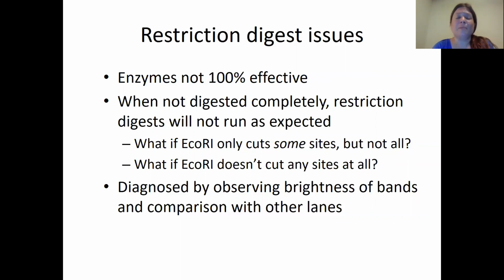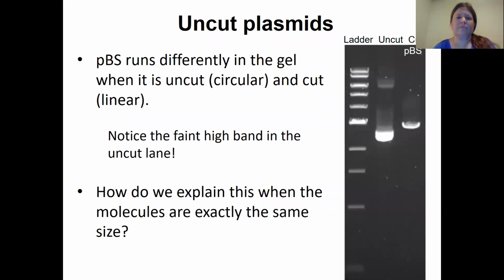You can also tell by comparing to other lanes, based on the brightness of the bands, whether you've got a scenario where none of the sites were cut. Let's look at that for a minute. Our plasmids are circular. The ladder that we have is linear. We know that pBluescript is 3 kb, but we're comparing that to a linear standard. And circular DNA is shaped funny. It's not going to run the same speed as linear DNA. If we look here at the cut lane, that's just pBluescript that's been digested with EcoR1, we can see that it's running at about 3 kb.